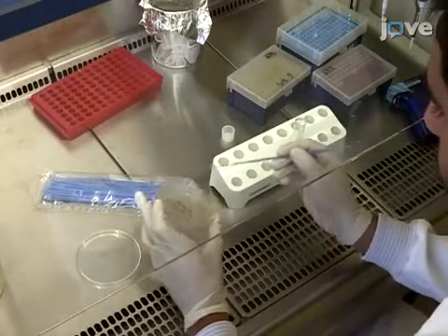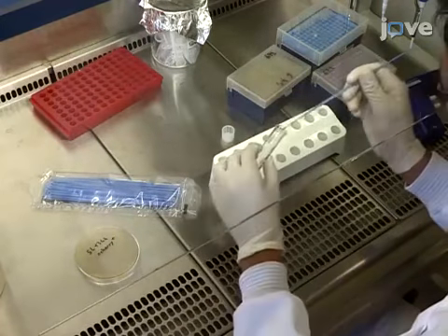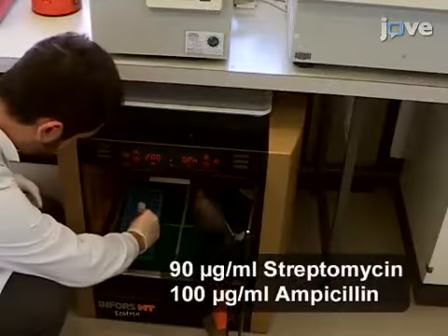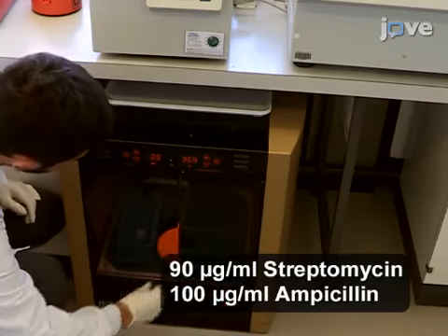Inoculate the bacterial strain 1 day before the infection in 3 milliliters of Luria Bertani medium supplemented with streptomycin and ampicillin in a shaker at 37 degrees Celsius overnight.